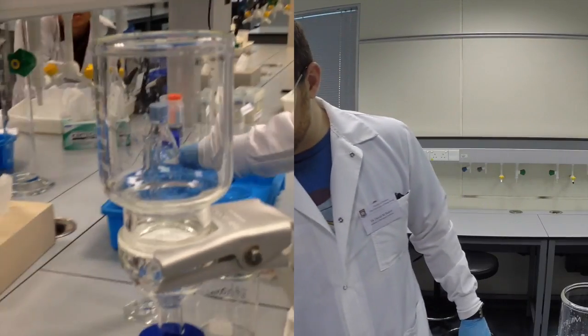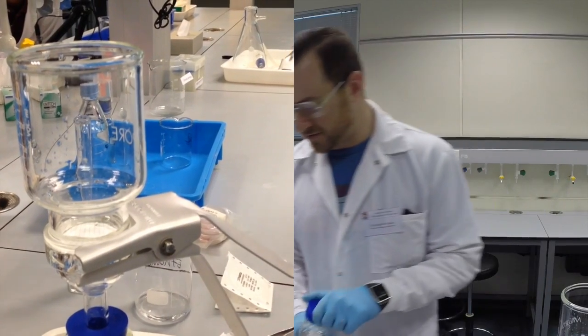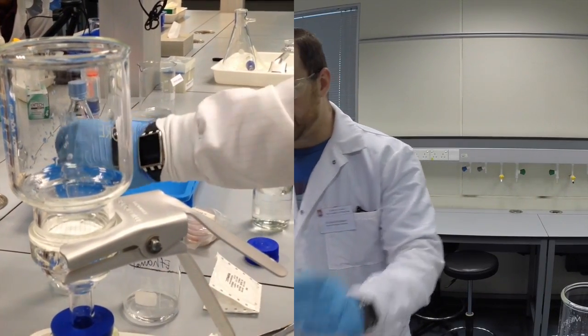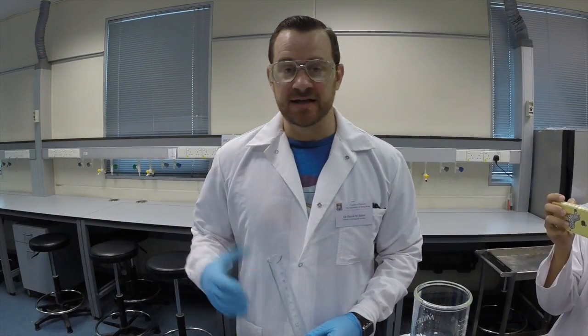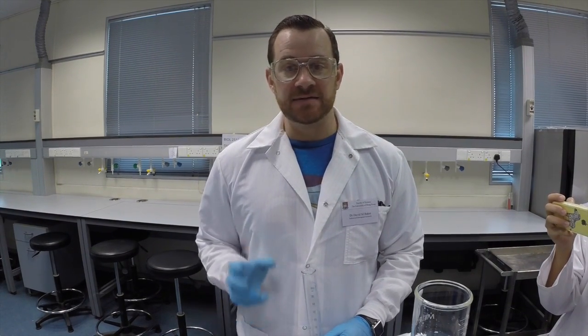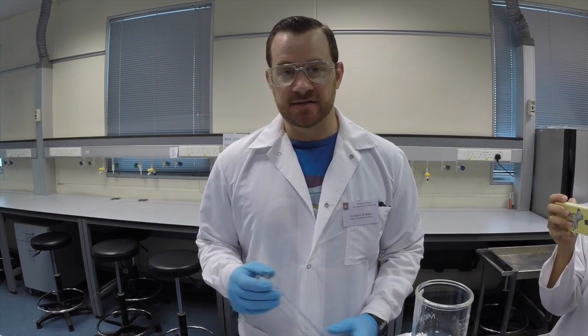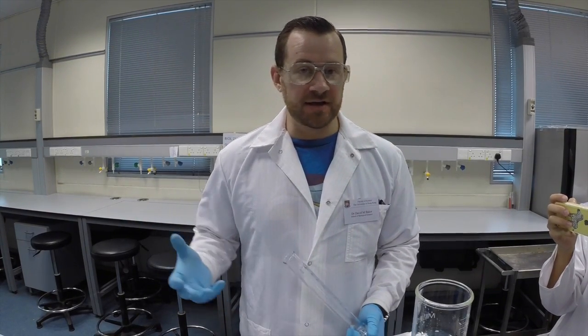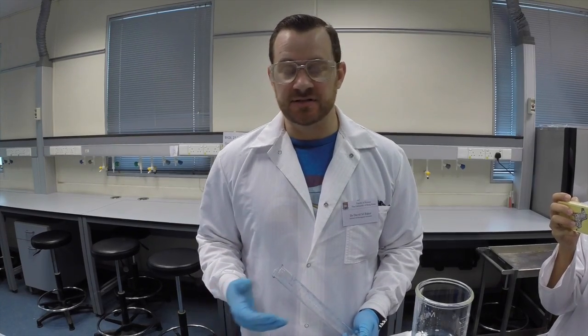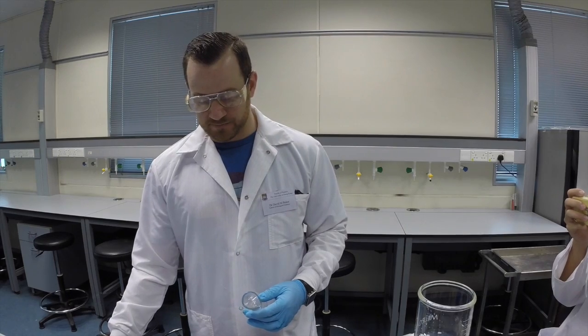So for the purpose of this demonstration, I will simply measure a volume of deionized water, so we don't expect there to be any microbes in this water. And in fact, this is what we'll do as a group to have a negative control. We want to know that the Enterococcus are not just growing on the plates because of contamination, so we will test that by preparing this negative control.